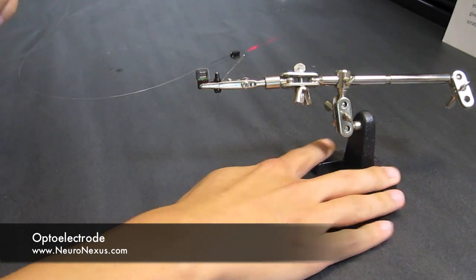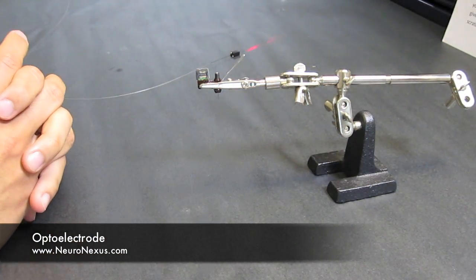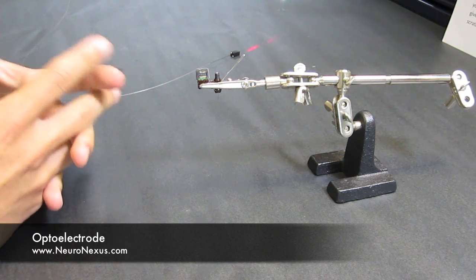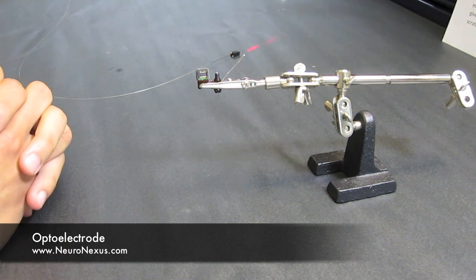By rotating, you depress the latching mechanism and it makes releasing a cinch. Hope that helps and good luck with your experiments.